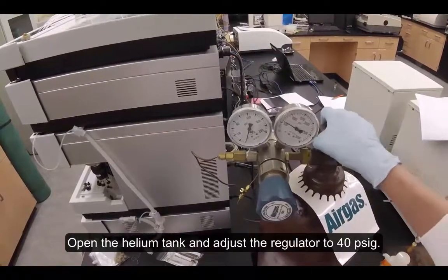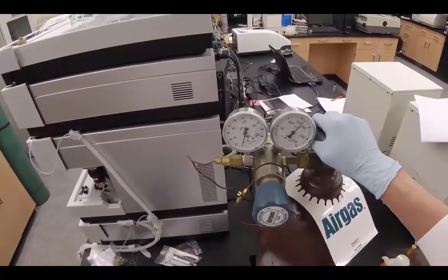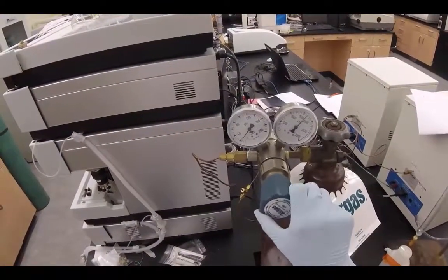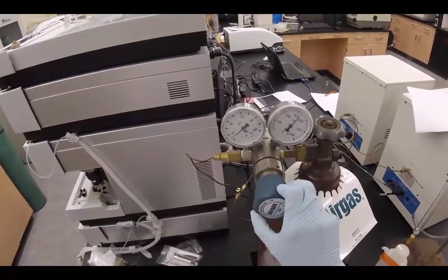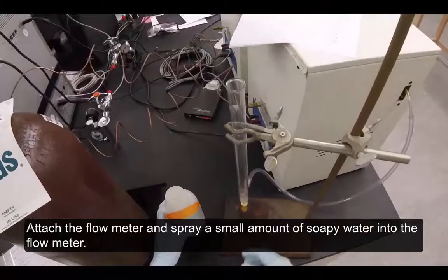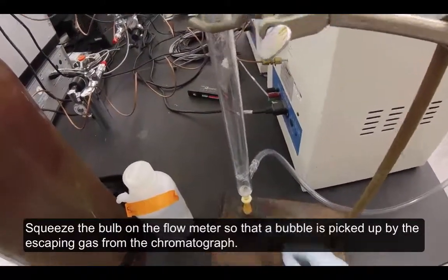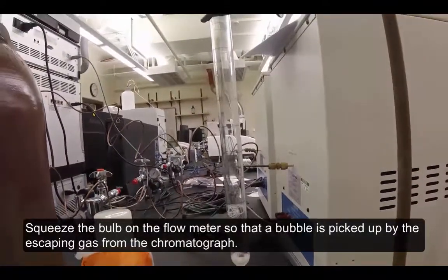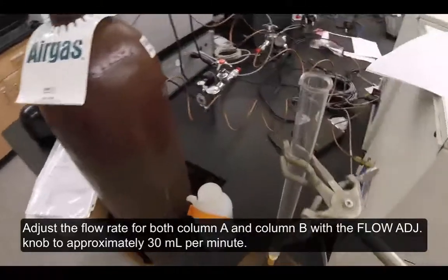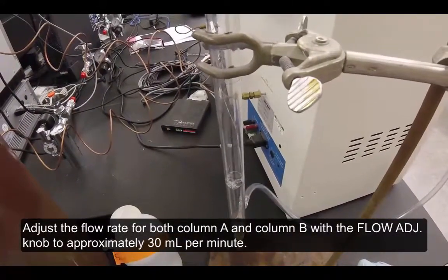Open the helium tank and adjust the regulator to 40 psig. Attach the flow meter and spray a small amount of soapy water into the flow meter. Squeeze the bulb on the flow meter so that a bubble is picked up by the escaping gas from the chromatograph. Adjust the flow rate for both column A and column B with the flow adjust knob to approximately 30 milliliters per minute.